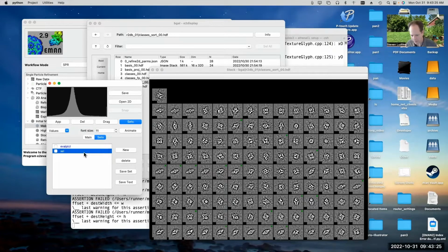But first I have to select the set over here that I want to modify. Once I've got the set selected, then I can just toggle things on and off for that set. I can also show other sets at the same time, and you can see there's two different colors there now. And again, hopefully you are seeing numerical labels in the lower left-hand corner here. I haven't gotten around to fixing that on my Mac yet. Macs seem to have this particular problem.